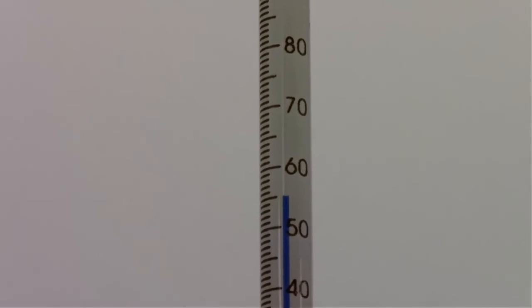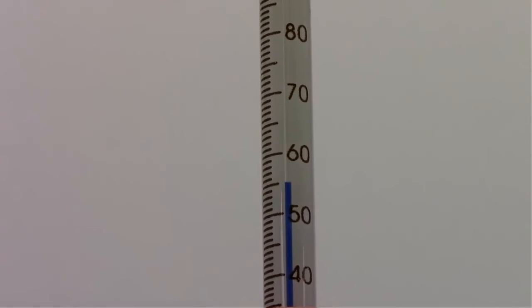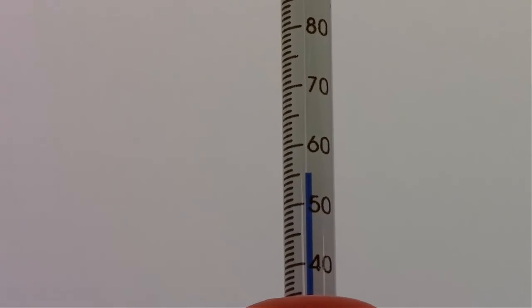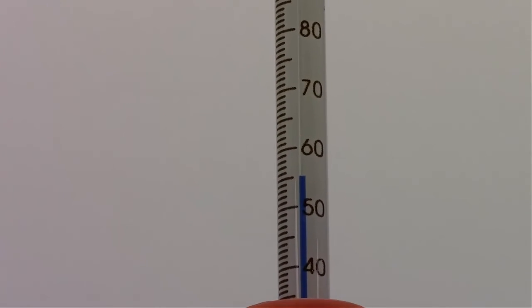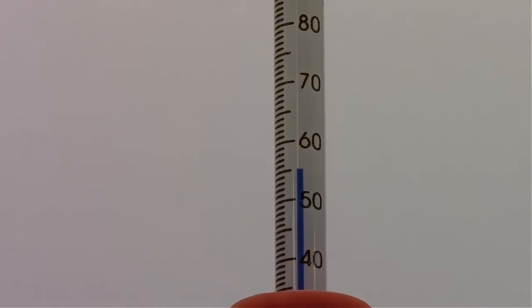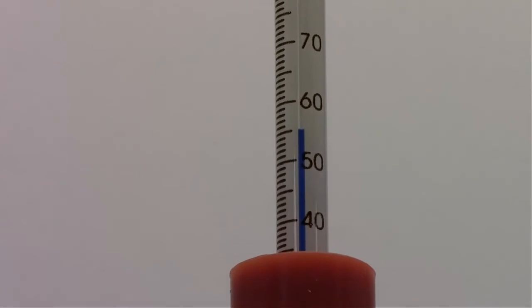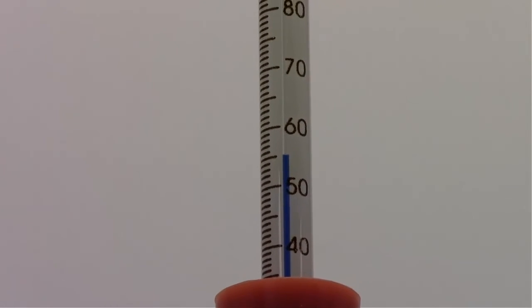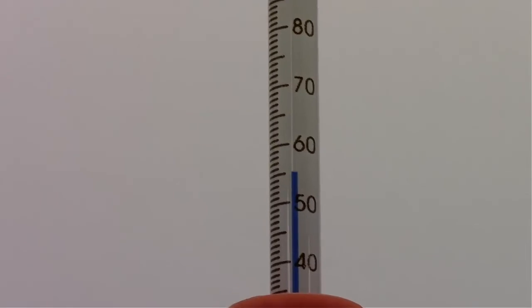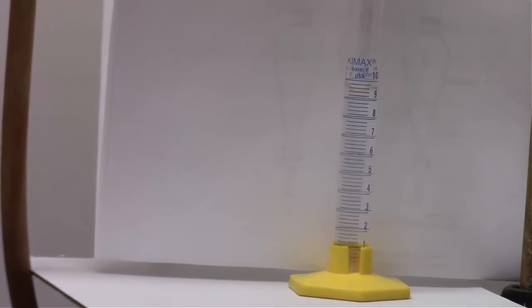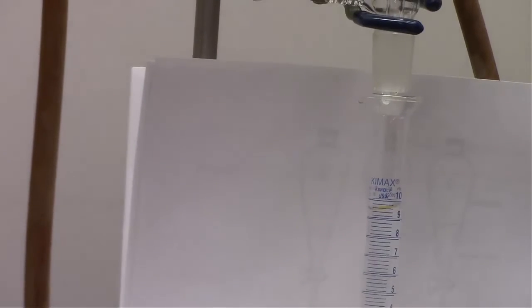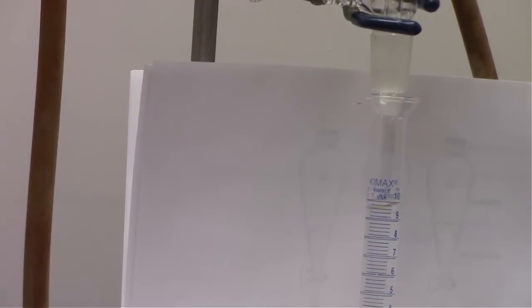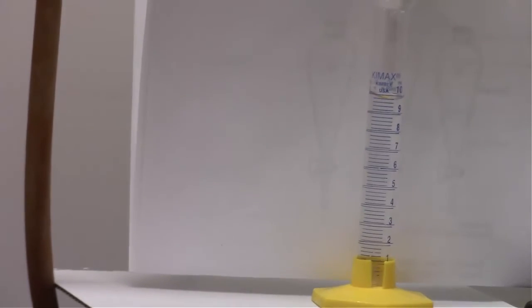Alright, now for this, it looks like we're collecting at 55 degrees Celsius. So, that's actually just slightly less than the literature value for the boiling point of acetone. I would say that it's hard to tell exactly how pure that is, but I would guess that this first 10 milliliters collected has a much higher percent acetone in it than the one we did for the simple distillation.